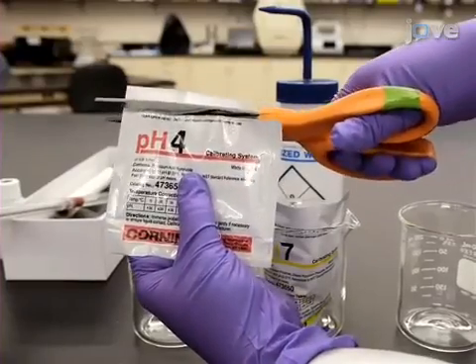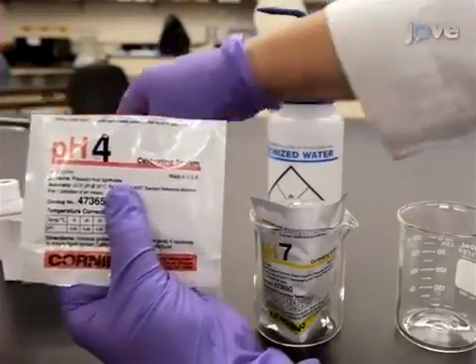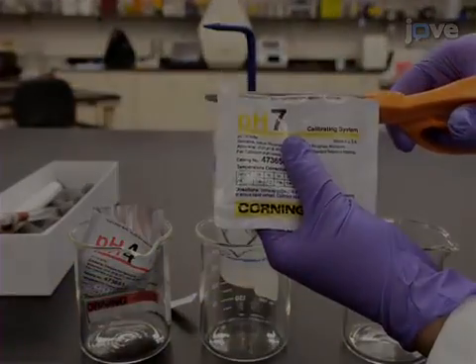Obtain one beaker with pH 4 solution and another beaker with pH 7 solution.